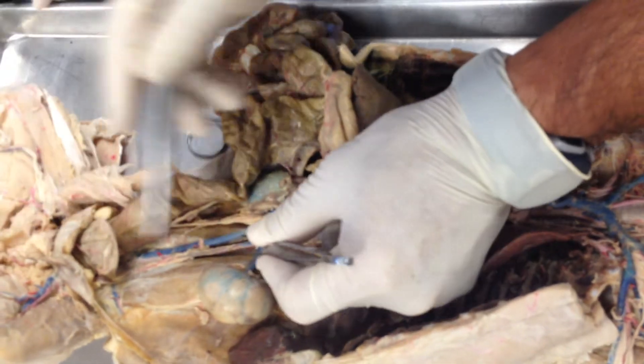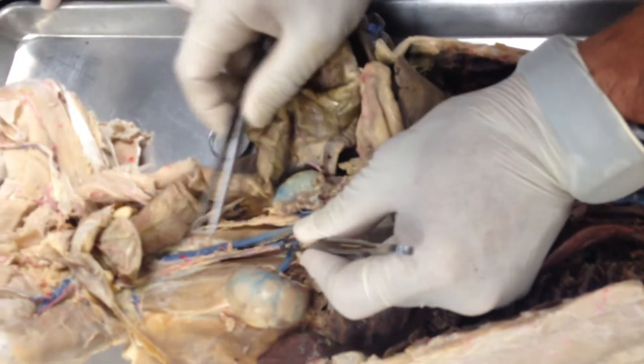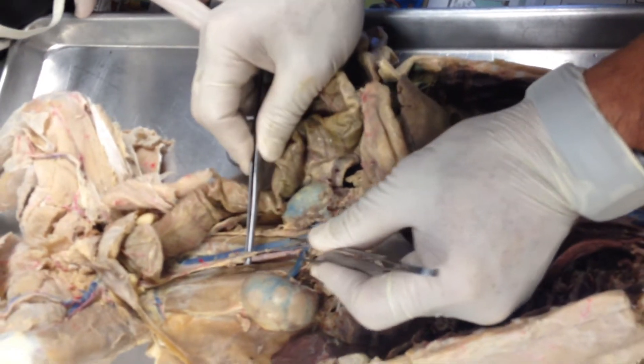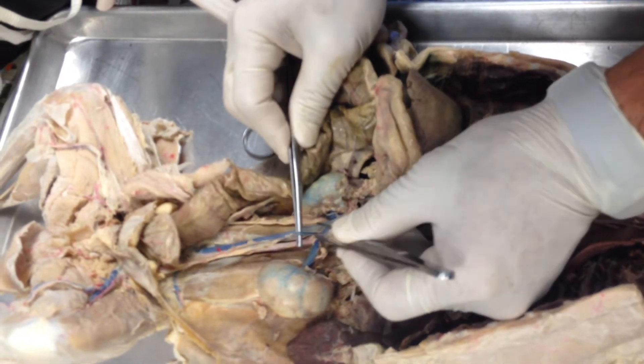There is your kidney and there is the renal vein. You guys have a male, so draining in on the left-hand side is the testicular vein right there.